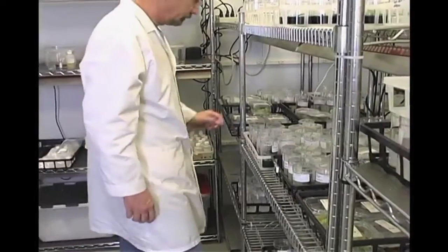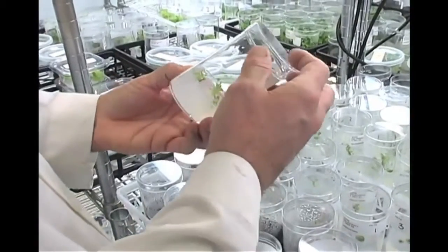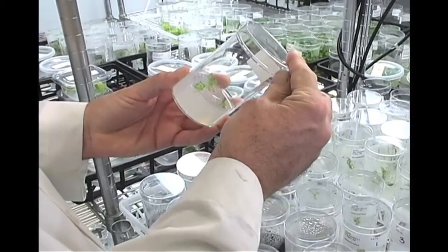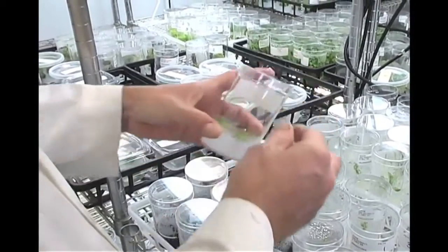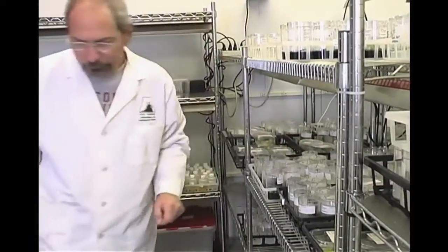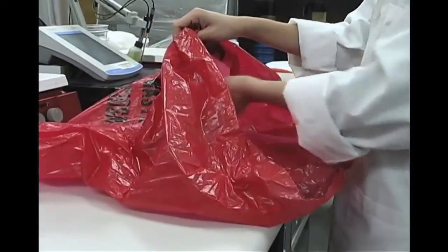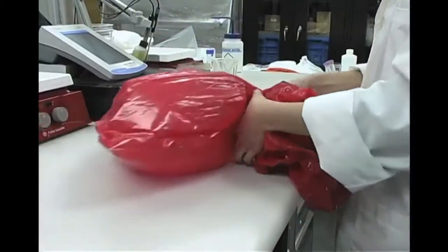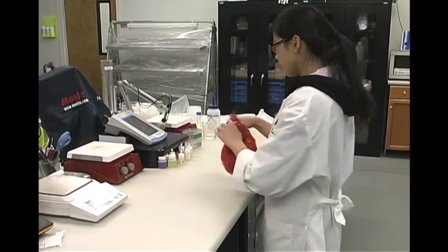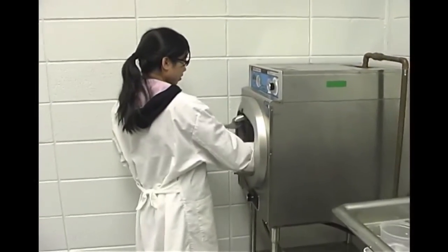Check cultures every 3 to 5 days for contamination. Slimy areas mean bacterial contamination, while fuzzy areas are due to fungal contamination. Do not open containers that are contaminated. The contaminants could be harmful. The only safe way to dispose of these is to autoclave or pressure cook them for 15 minutes at 15 psi. Contaminated plastic dishes can be placed inside a large can or autoclavable bag to be sterilized before discarding.